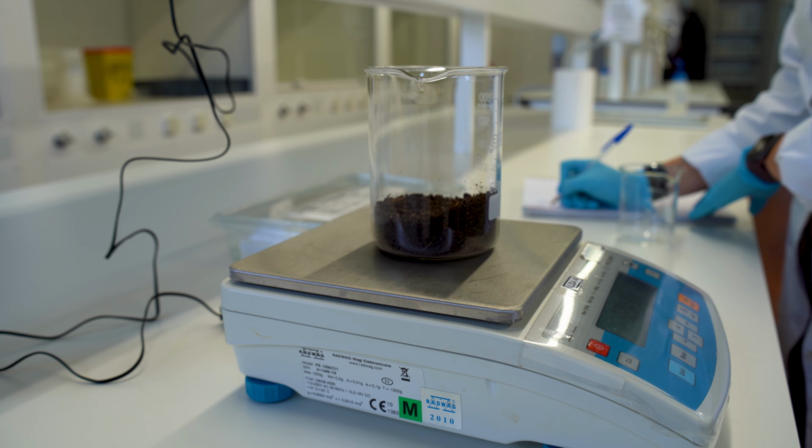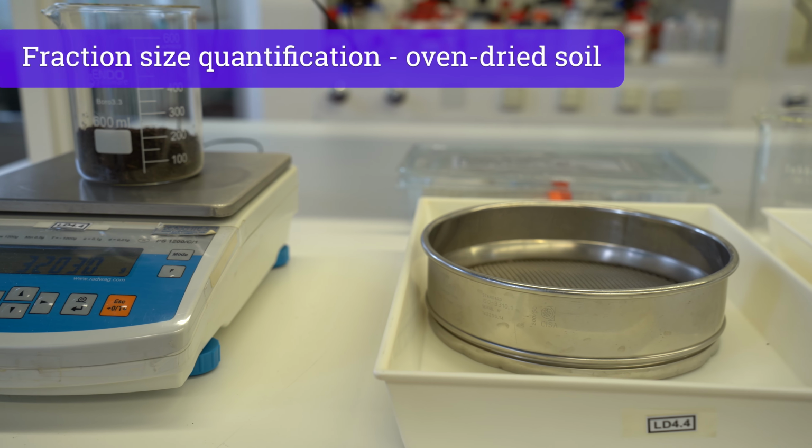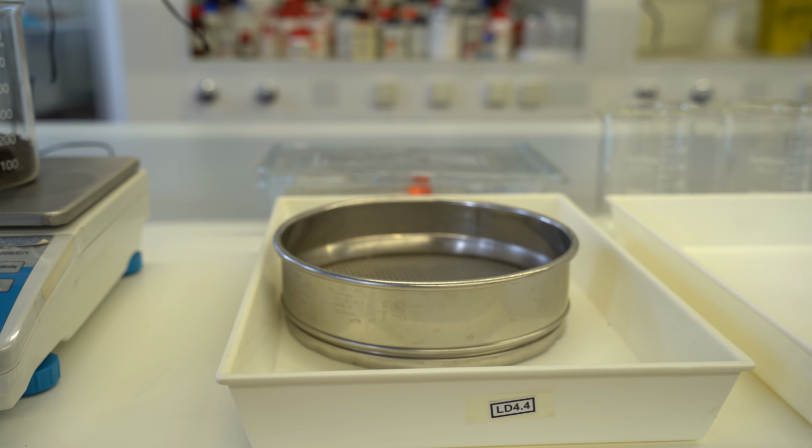soil moisture content. To assess fraction size quantification, you will need an analytical balance, a clean container, and a 2 mm sieve.